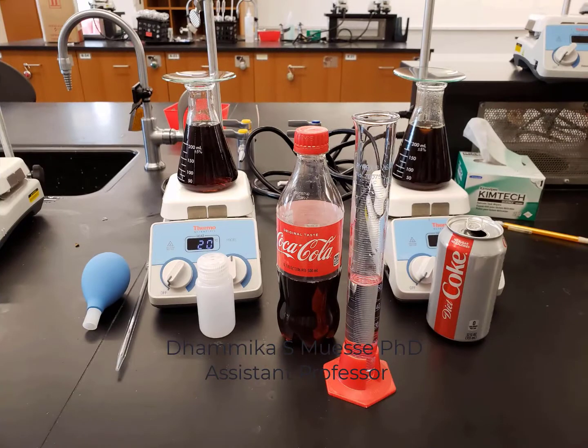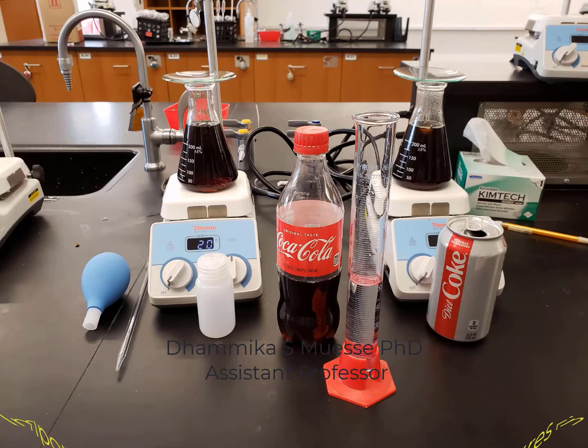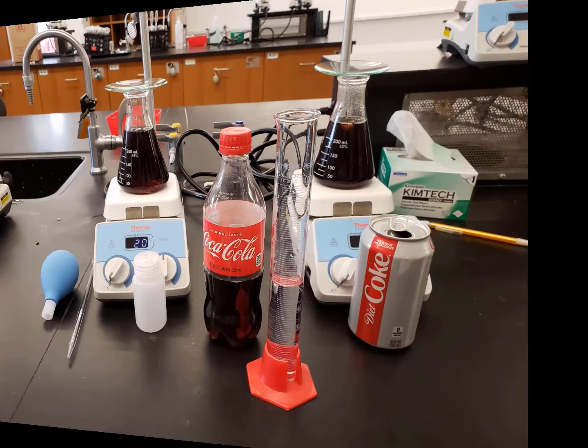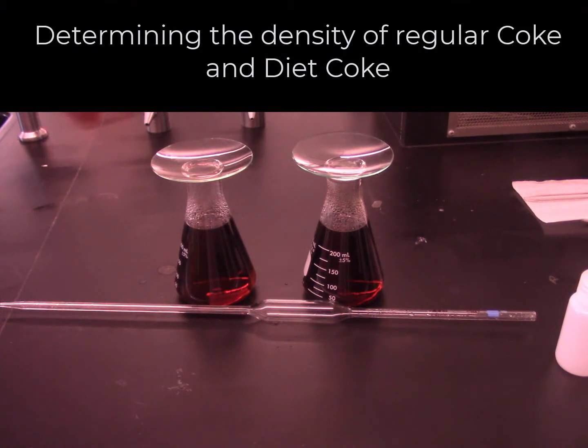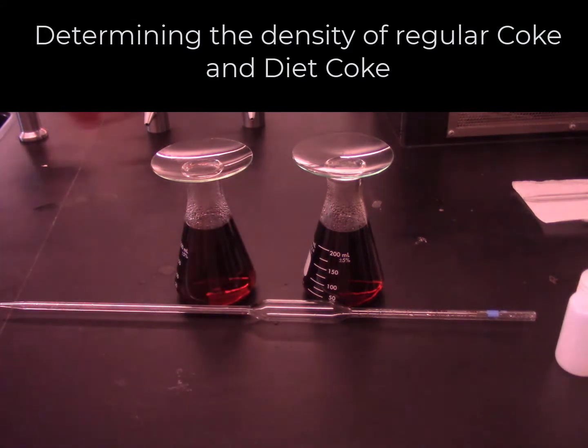In this video, I am going to discuss the importance of significant figures and precise data in problem solving. I will carry out a simple experiment to determine the densities of regular Coke and Diet Coke. Here I have samples of Coke and Diet Coke, both degassed by stirring overnight. This is the Diet Coke and this is the regular Coke.